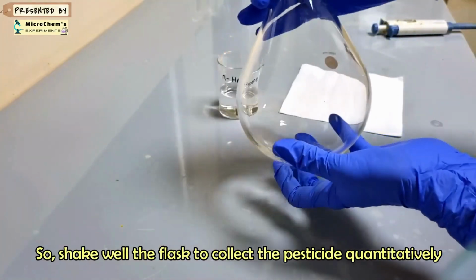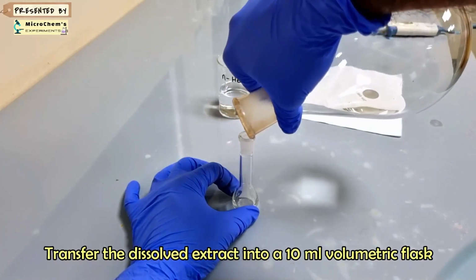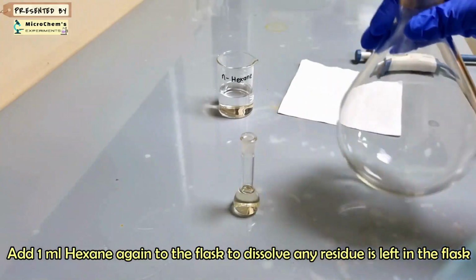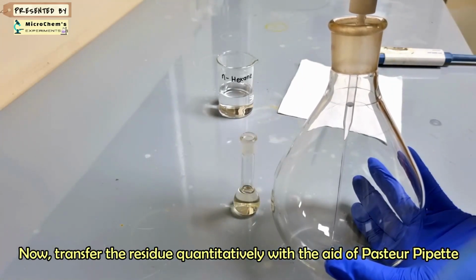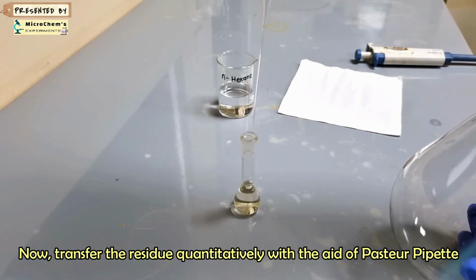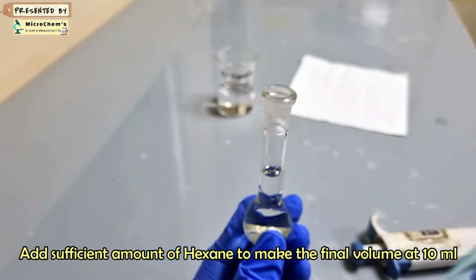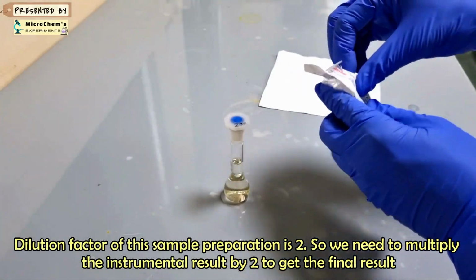It is necessary to shake the flask well for a long time to collect the pesticide quantitatively. Dissolve the residue with hexane and collect into a volumetric flask to make the volume of 10 ml. Transfer the dissolved extract into a 10 ml volumetric flask. Make the final extract volume at 10 ml. Dilution factor of this sample preparation is 2, so we need to multiply the instrumental result by 2 to get the final result.